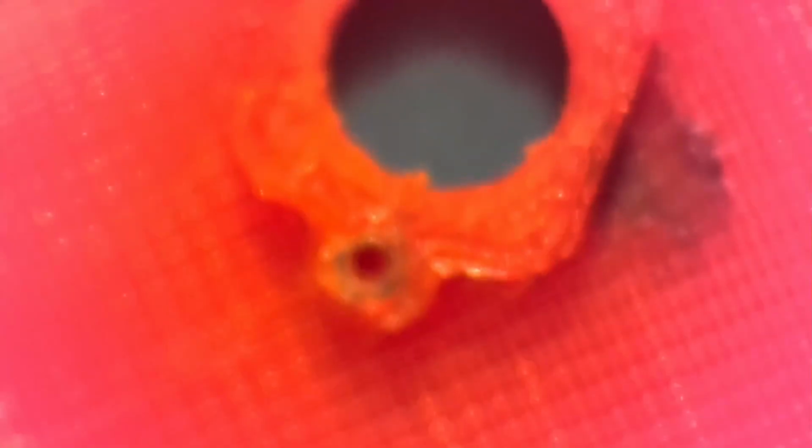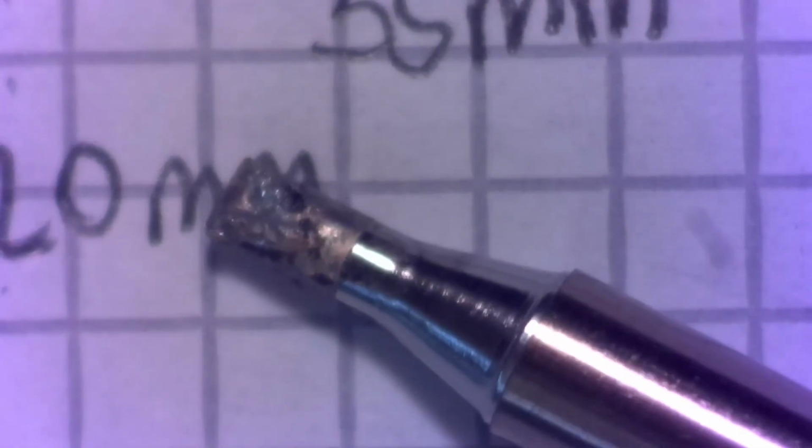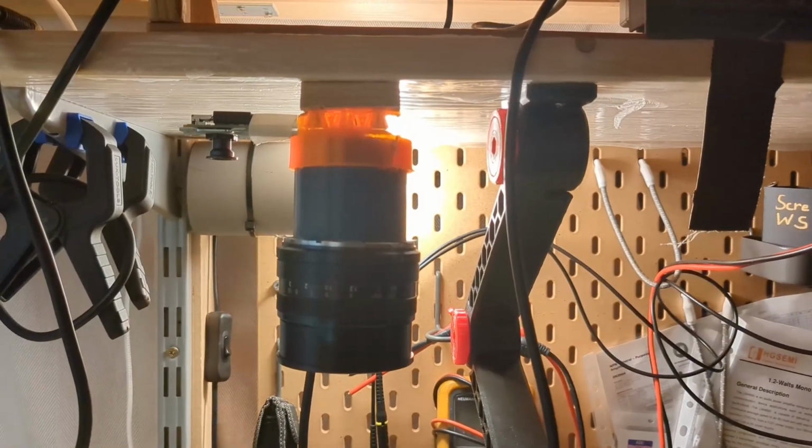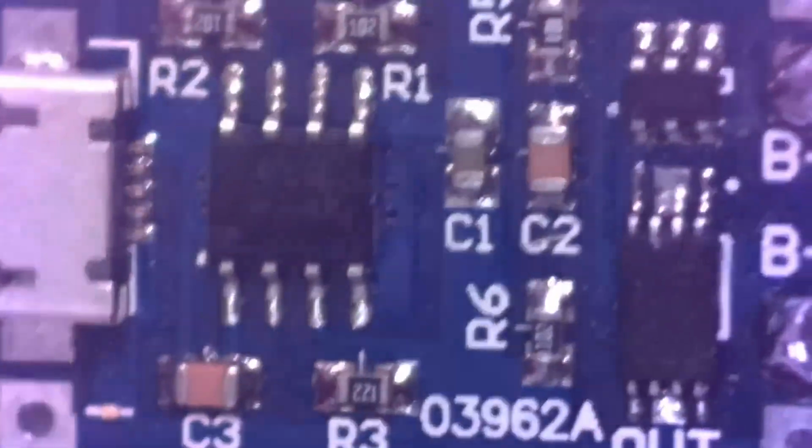So as you can see, the image is a bit washed out and the mount is really wobbly, for my taste at least. But I would say for a camera and a lens that had no use before, this is still surprisingly good. Also, because it's really low latency, it can be used for soldering without too much suffering of hand-eye coordination. But I must fix the mount somehow, as if the table moves, the camera moves a lot, and this really messes up everything.